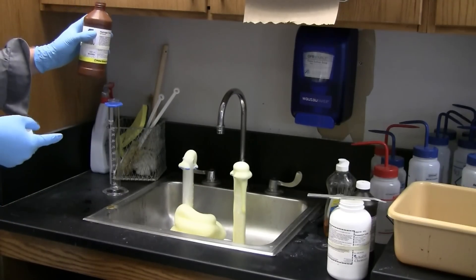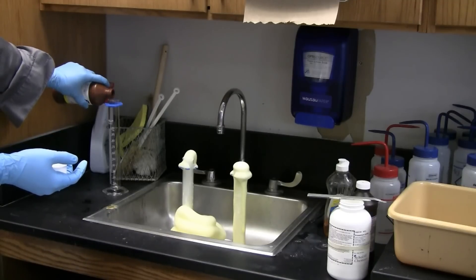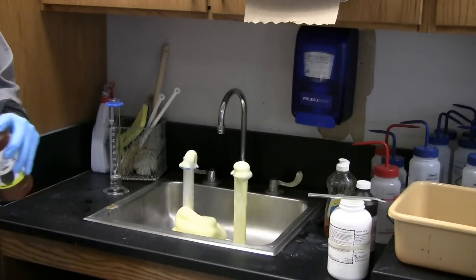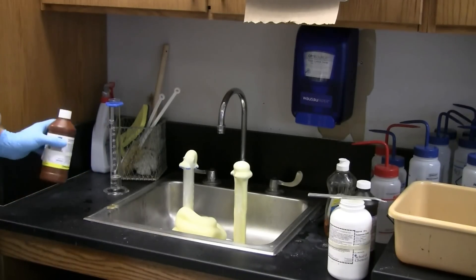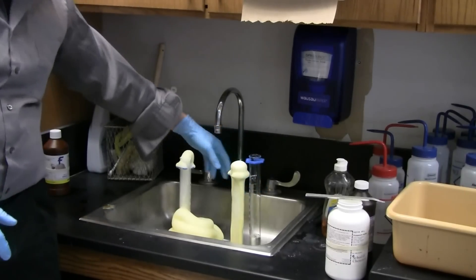So now we're going to try it without the dish soap and see what happens. What do you guys think is going to happen? Nothing. Nothing? Yeah. Something's definitely going to happen. It's going in the same. Don't worry. All right.